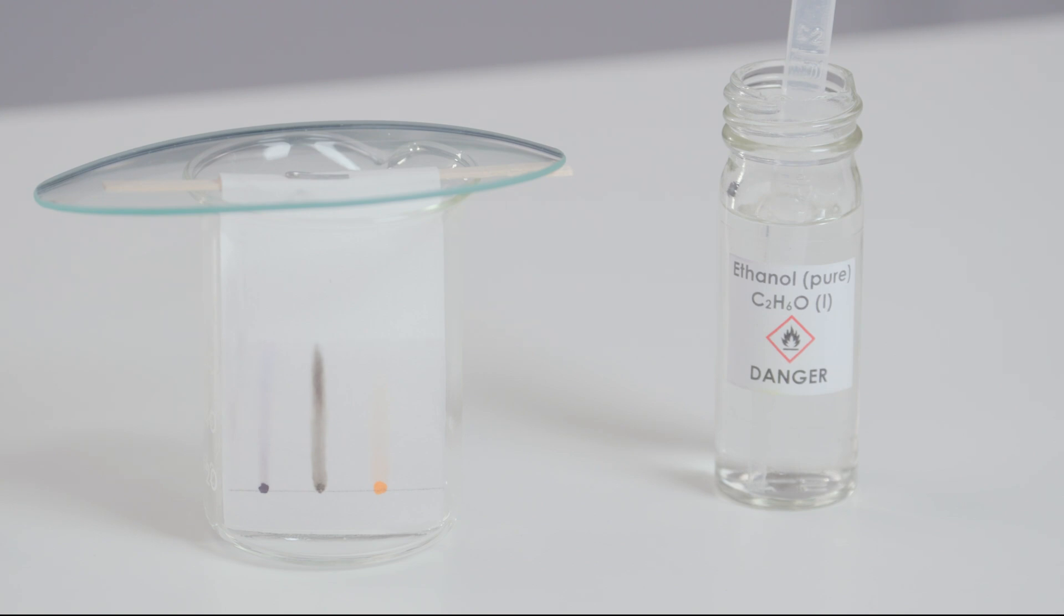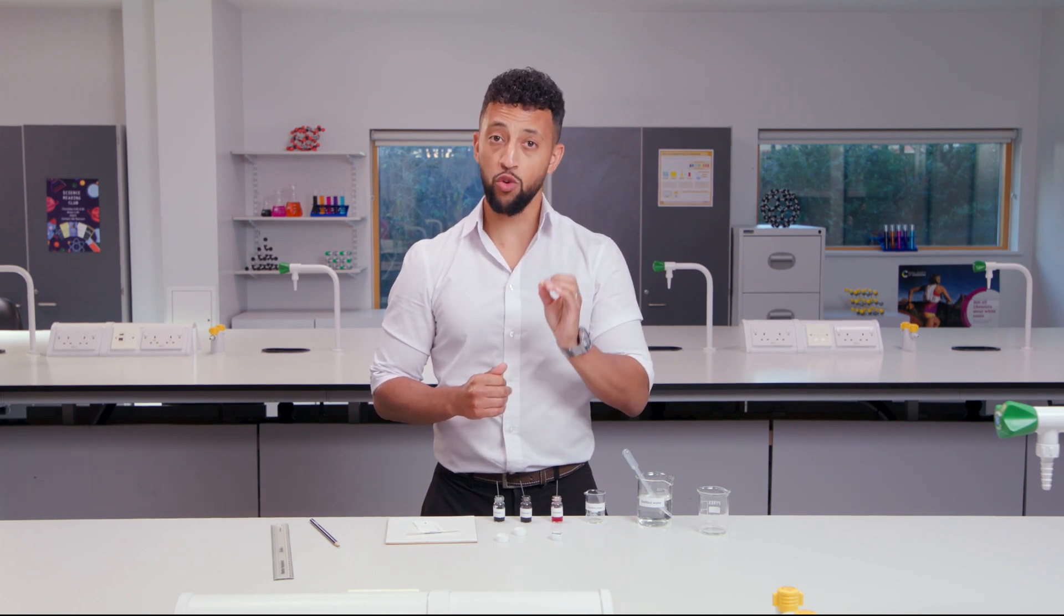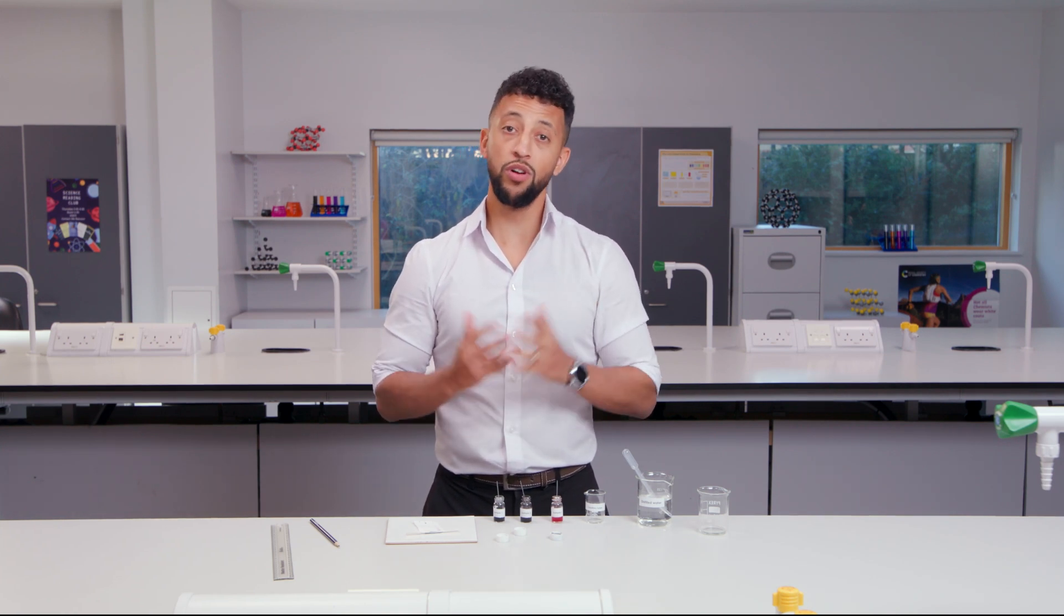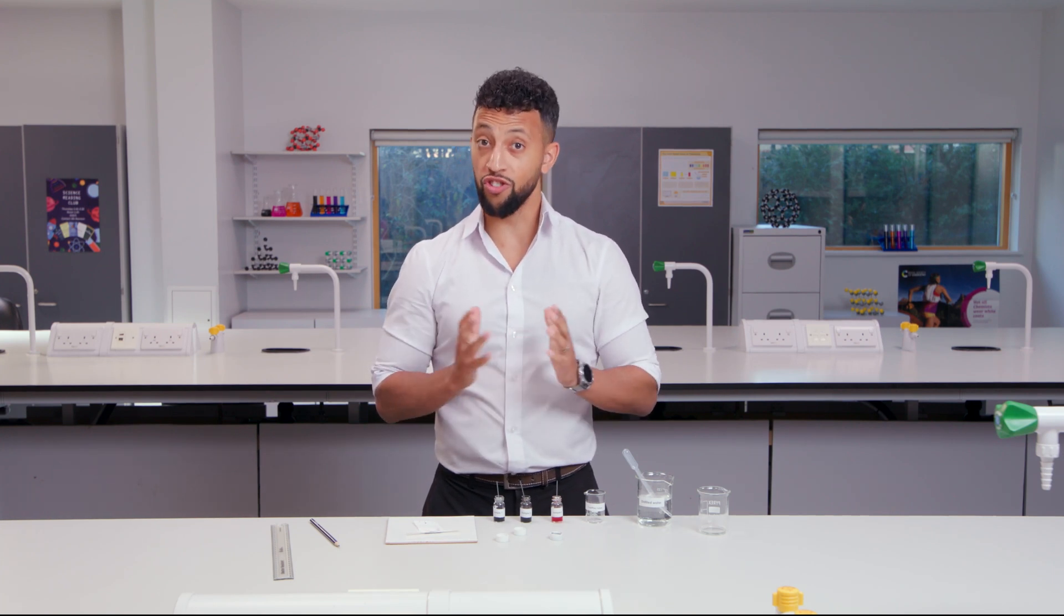You can also repeat this experiment by changing the stationary phase. There is a very sensitive method using a silica powder on a plastic backing called thin layer chromatography or TLC. The TLC plate can separate chemicals such as amino acids.